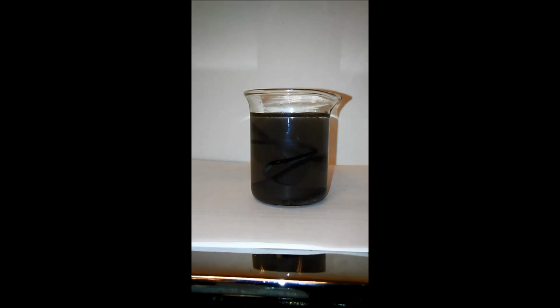Anyway, the reaction that we are doing is similar, but iron metal reacts, and this here I would write right now, with silver nitrate solution. And so then iron, of course, the symbol is Fe, and it's a solid.